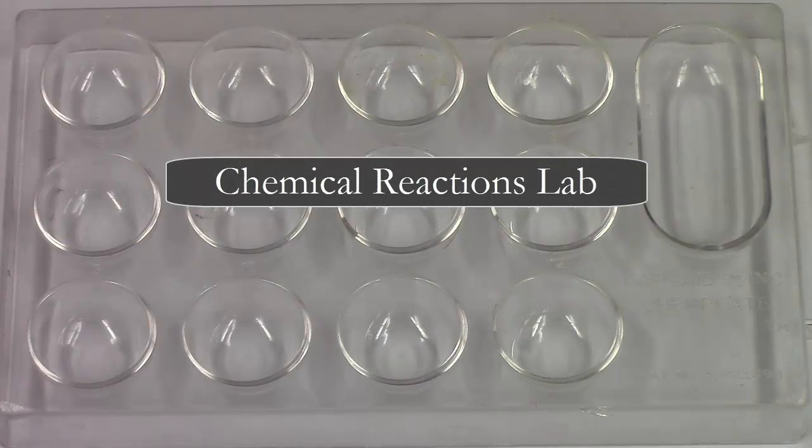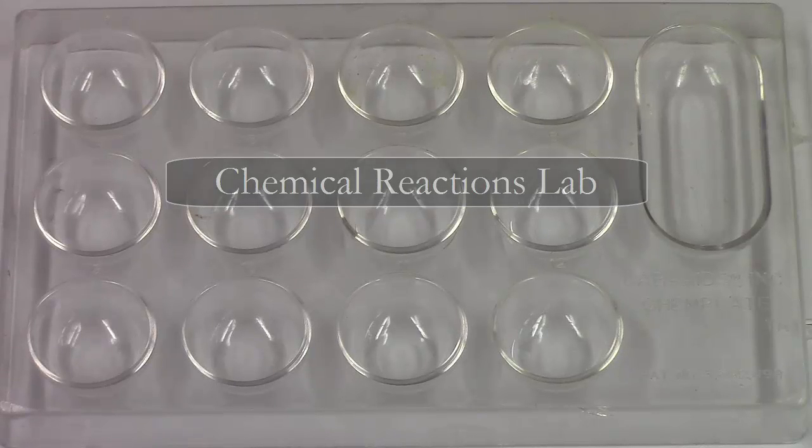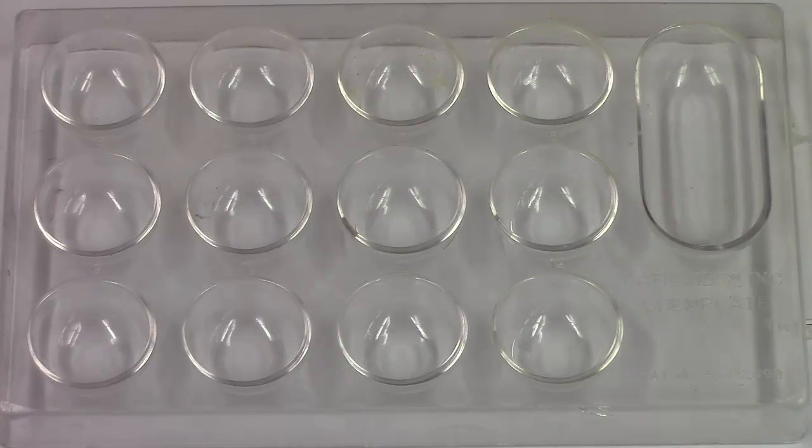Welcome to our chemical reactions lab. In this video, we're going to be doing 10 chemical reaction demos, and your job is to predict the products and write down any observations for each reaction. Let's get started.